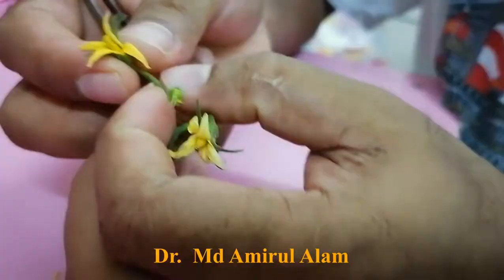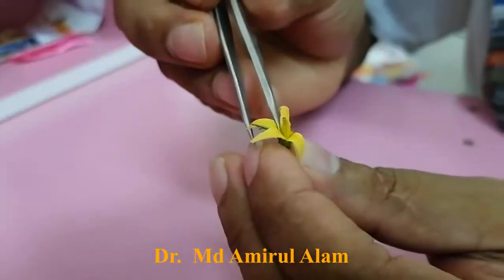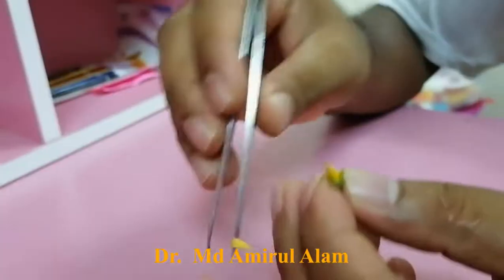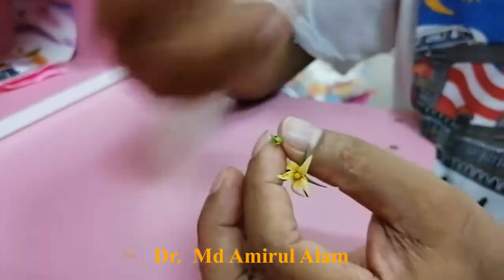The flower for pollination must be from the male parent for cross-pollination. I am now showing how to do the cross pollination. You pick off the open flower from the male parent. You can collect the anther directly or remove the sepals and petals as well. When the flower is at anthesis — meaning it is shedding pollen — you just touch it on the stigma very carefully. There should be plenty of pollen. This touching is the cross-pollination.